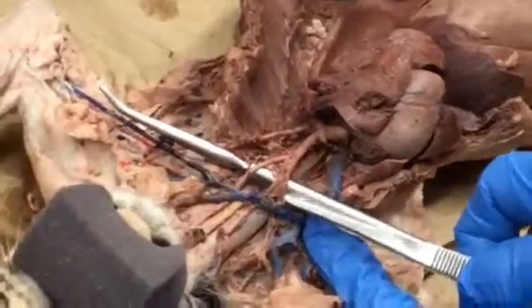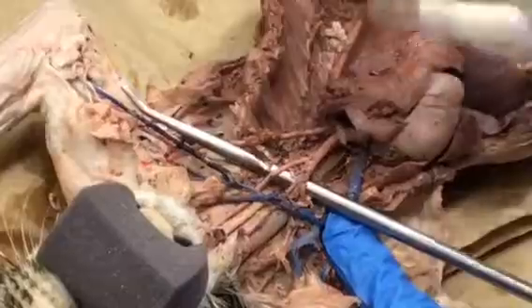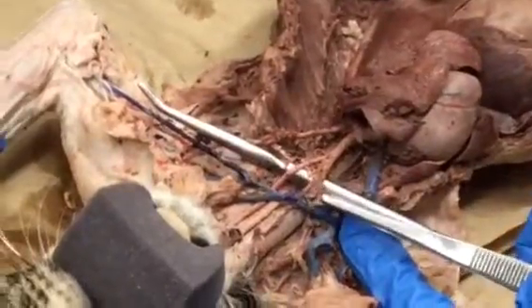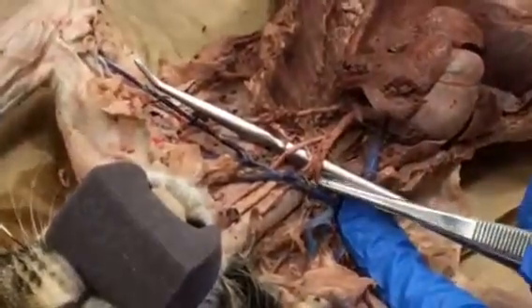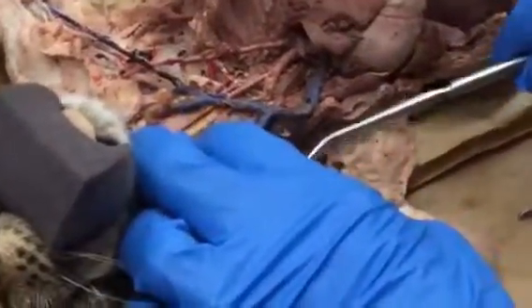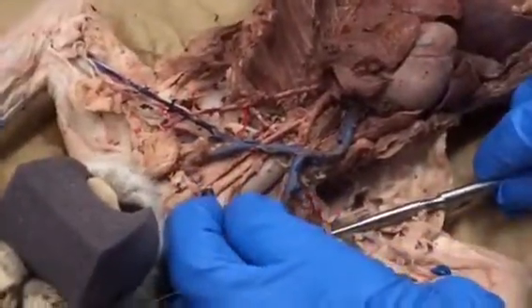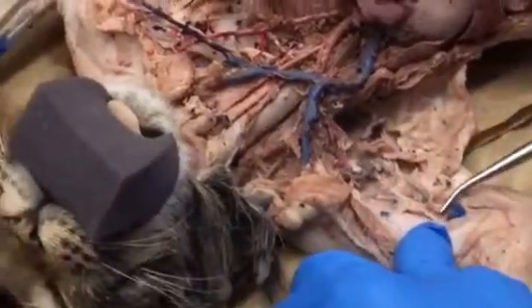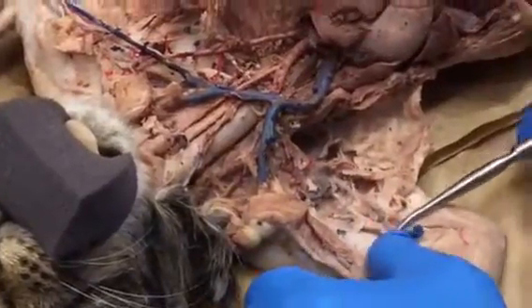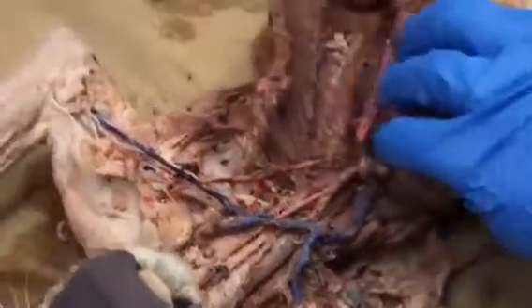is the right subclavian artery. We saw the left subclavian artery over here. Now we see the right subclavian artery branching off the brachiocephalic. Follow the right subclavian artery up and over into the armpit. I'm faking it now because mine's broken, but this would be the right axillary artery. Way down here towards the elbow would be the right brachial artery. Okay? Now let's follow these vessels down into the chest, into the abdominal area.